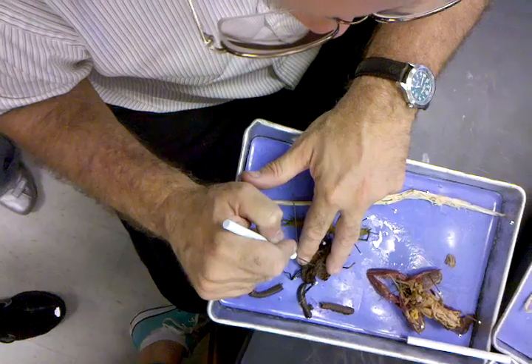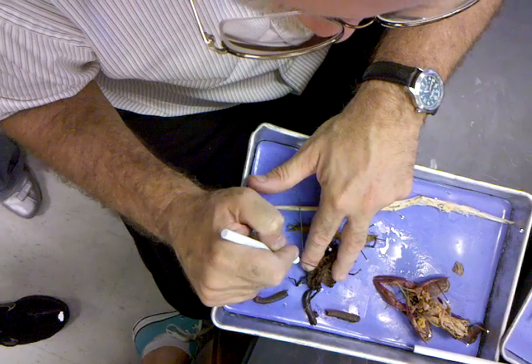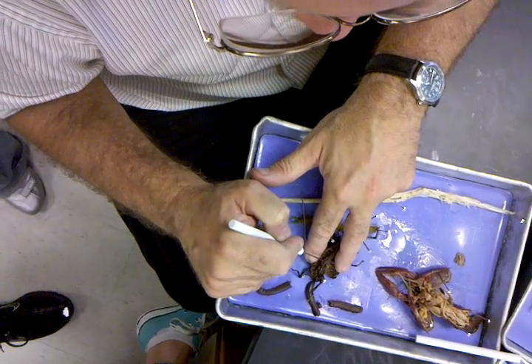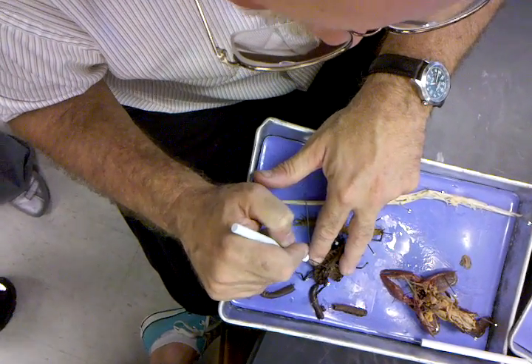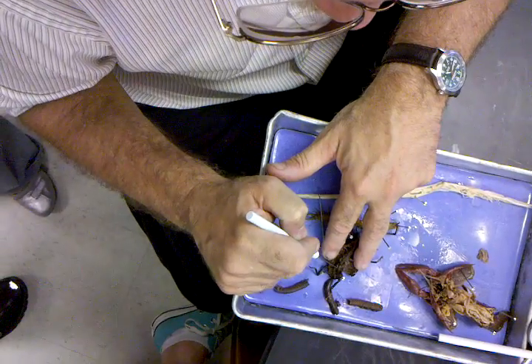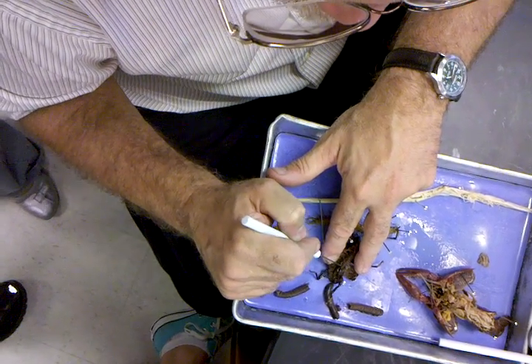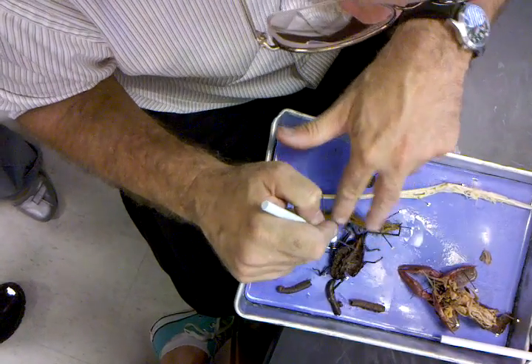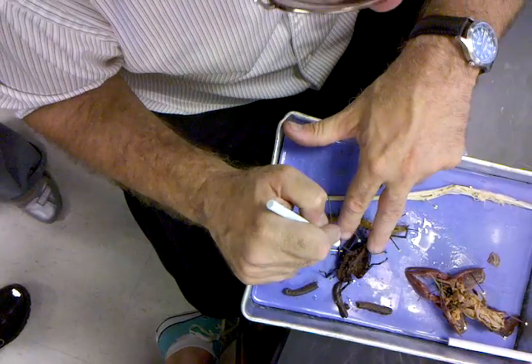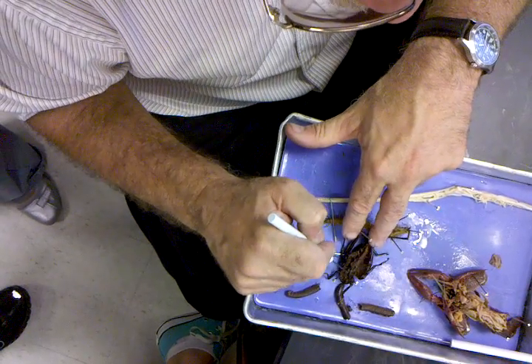Do you see these little finger-like projections? These are called pyloric ceca. This is where the stomach is. Crop. Gizzard. Stomach. Intestine. Got it?